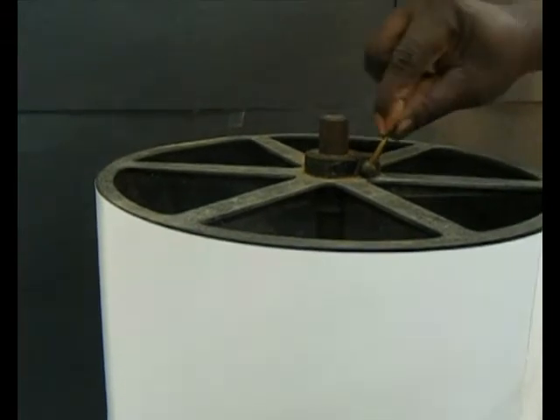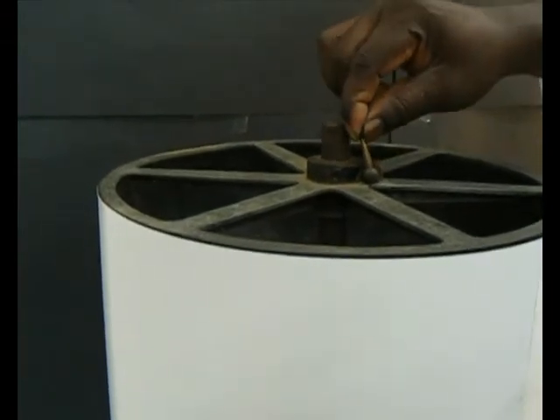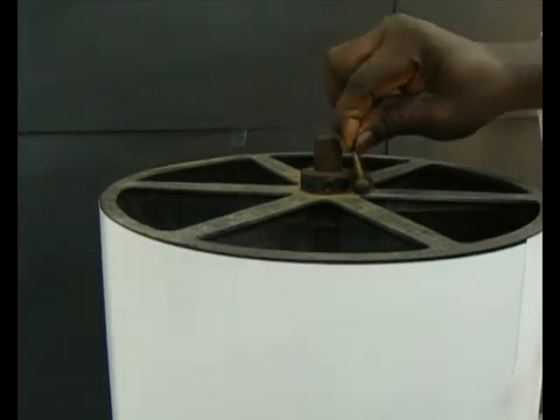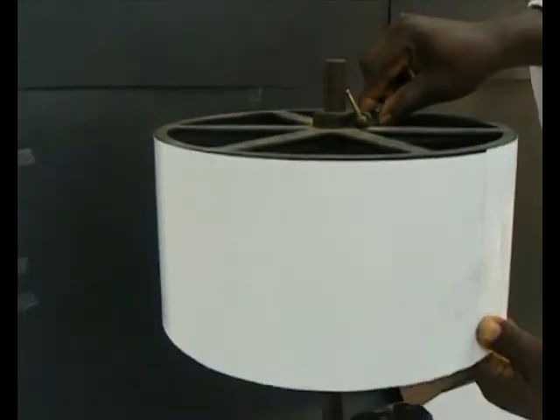The Kymograph has a knob at the upper end, which controls the vertical movements of the Kymograph drum, on which a tracing paper has been mounted.